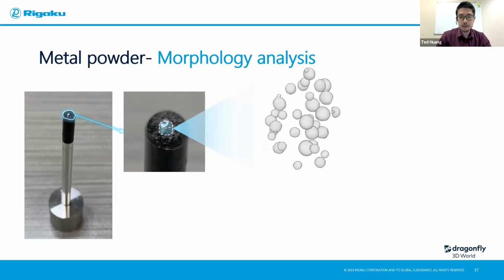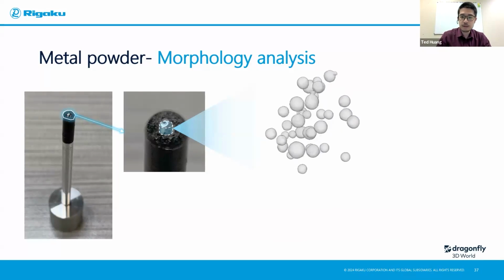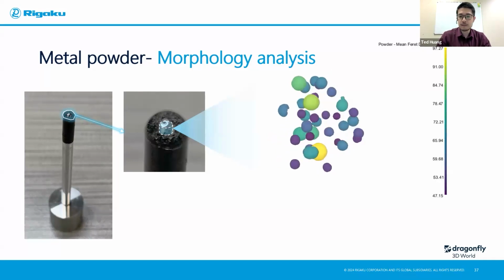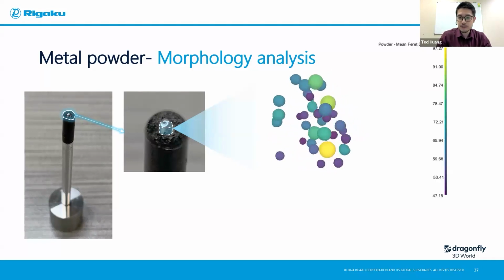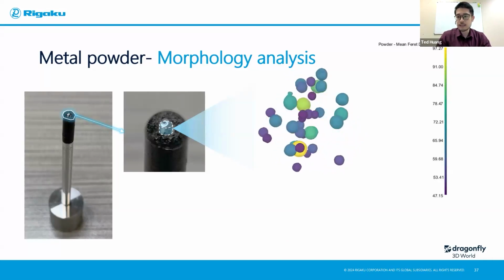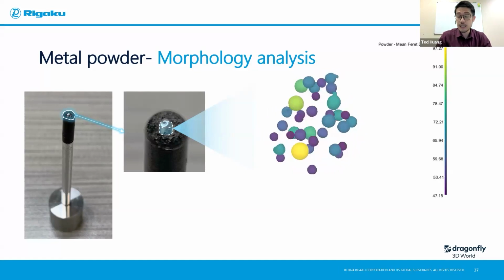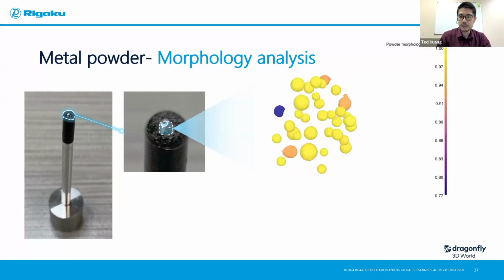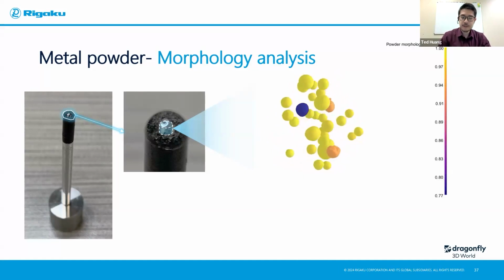And you can already see, oh, there are some agglomerations for some of the powders, some deviation from the spherical shape they're supposed to have, some of them as if they're being punched in the center. You name it, you can do the analysis. In this case, I'm showcasing a mean Feret diameter or some other analysis like the morphology, like the sphericity.